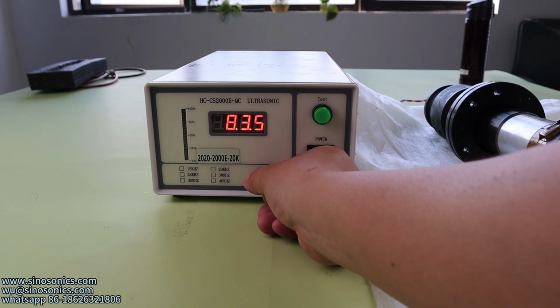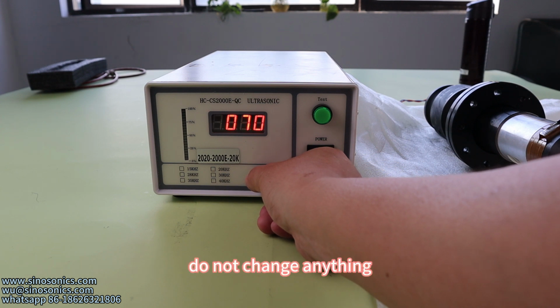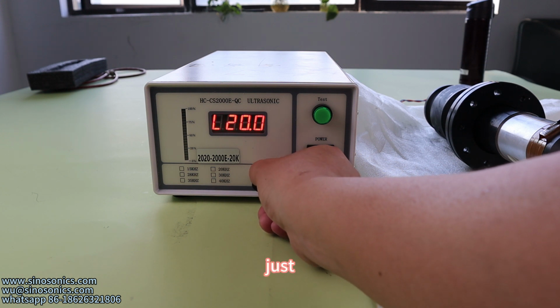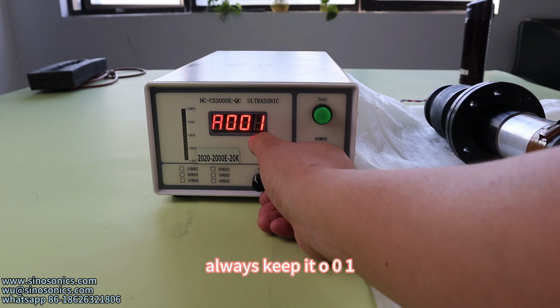B, there's nothing to change. This one, nothing to change. Do not change anything. C, do not change anything. Just H, L, and R. Always keep it 001.